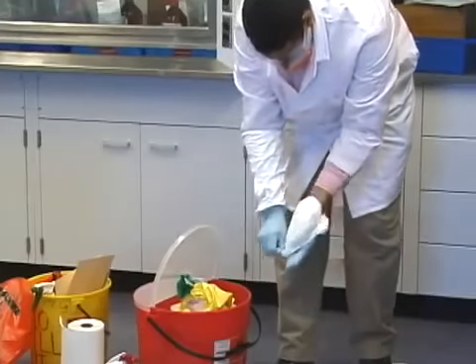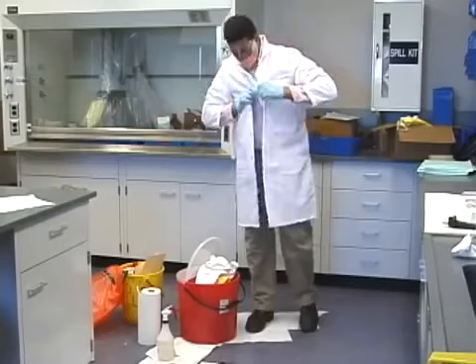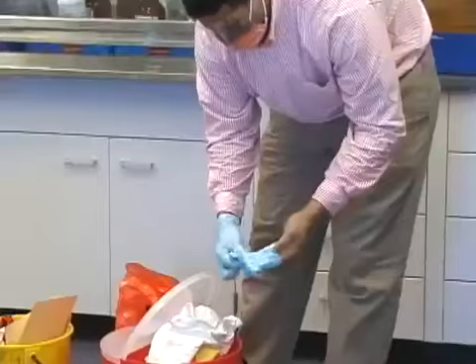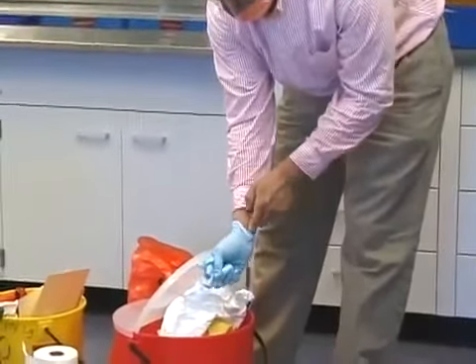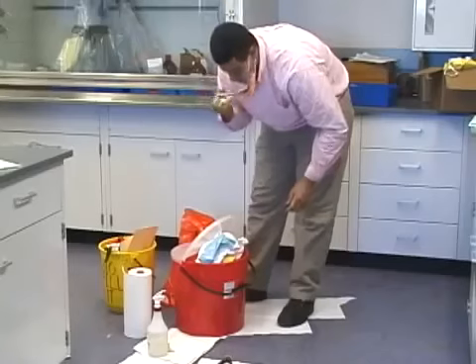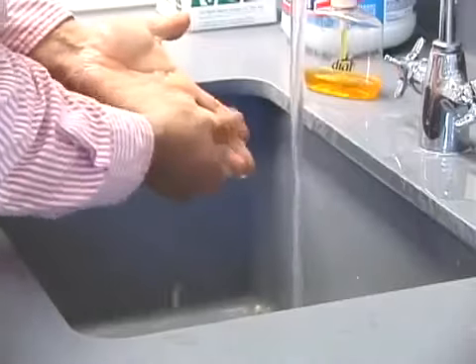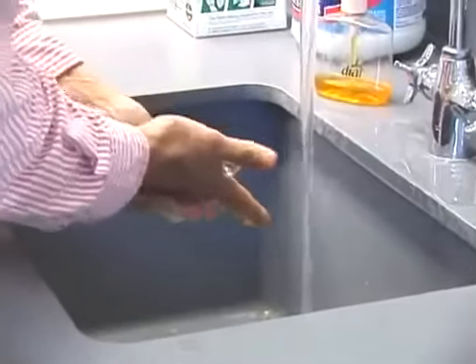sleeves if worn, lab coat, inner gloves, and face protection. Of course, you should always wash your hands thoroughly after removing your personal protective equipment.